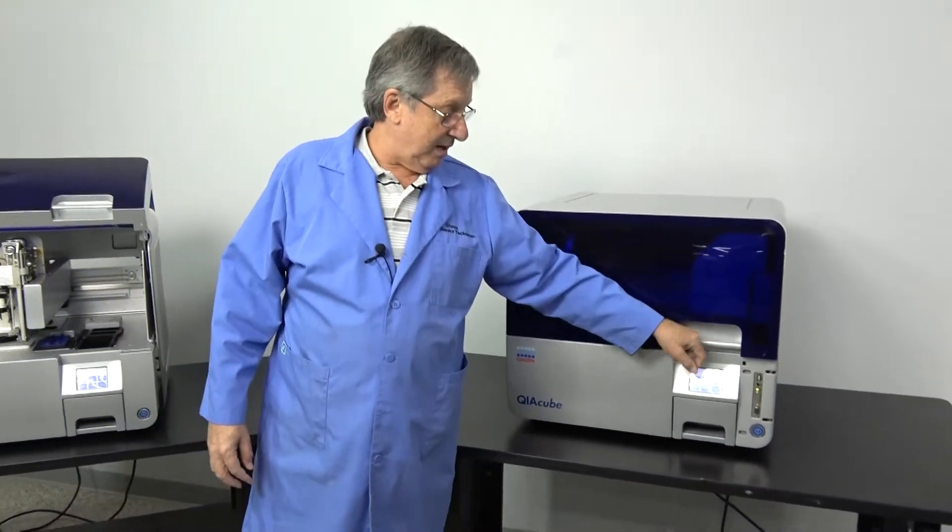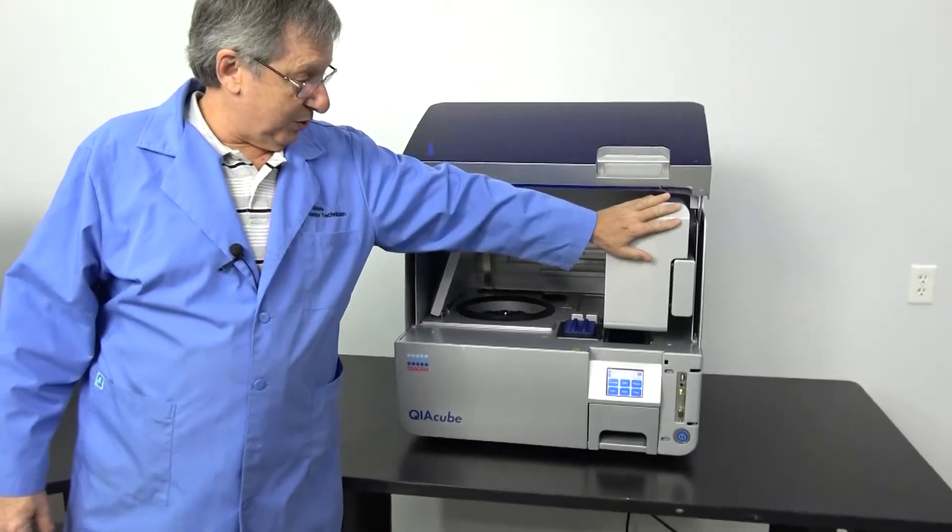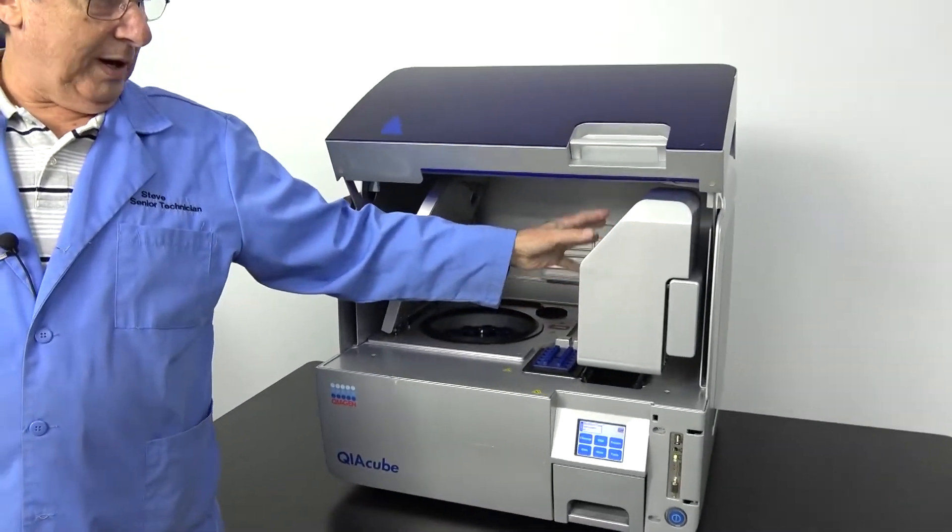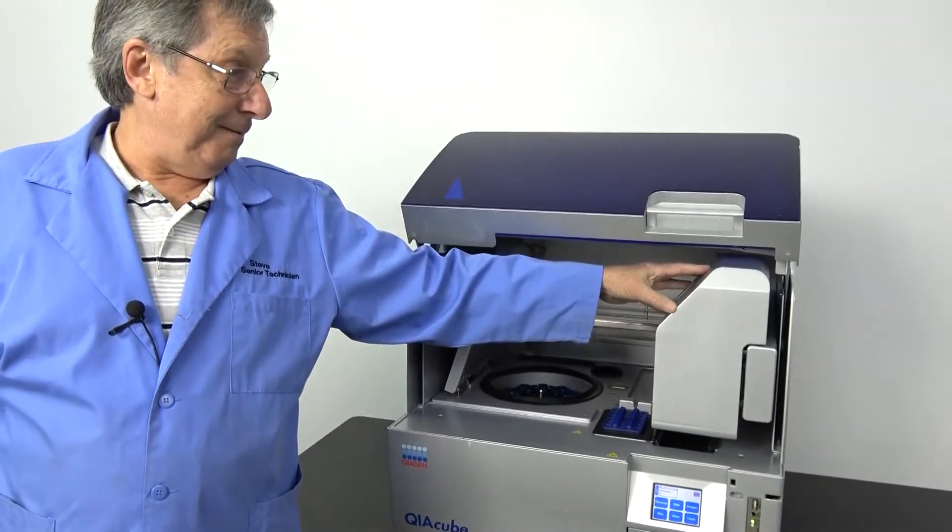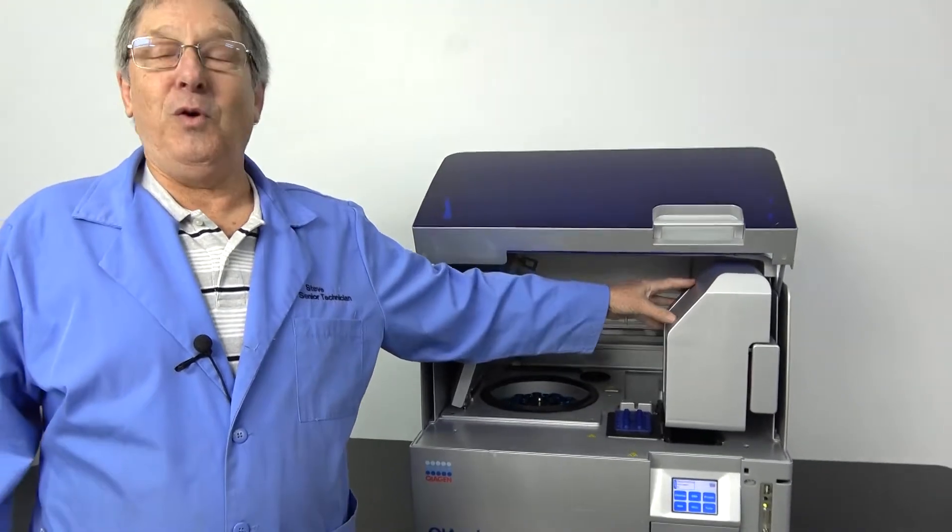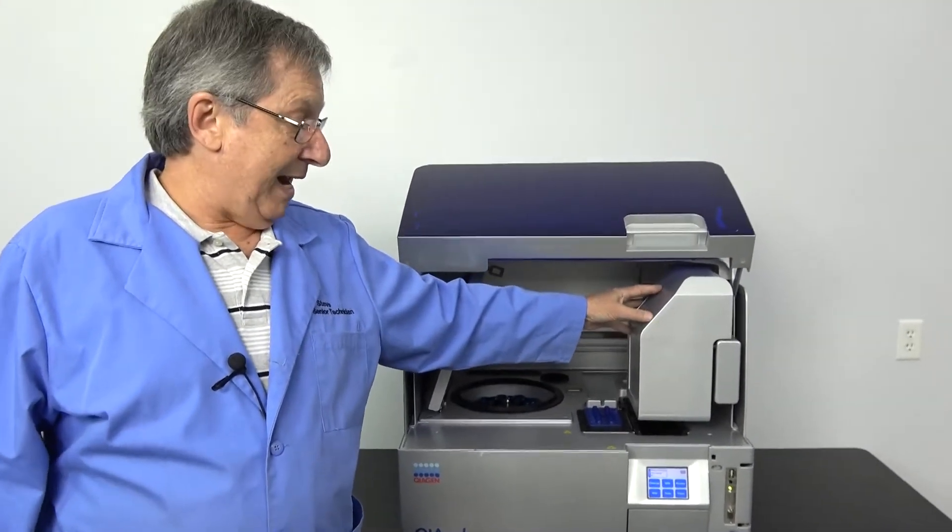So we've taken off the shroud cover on what I consider the really marvel of these units, the liquid handling head.